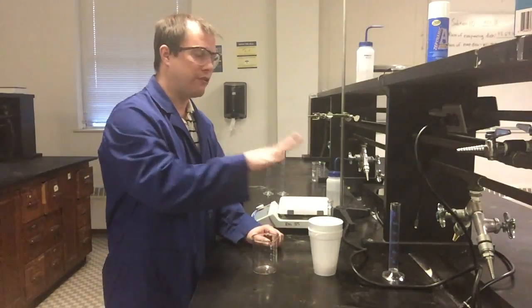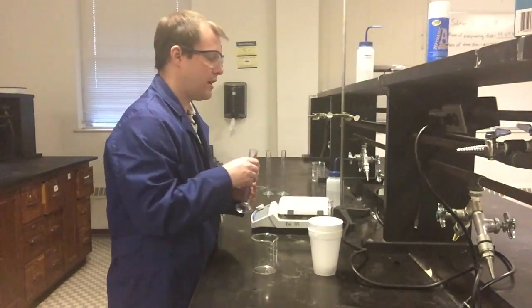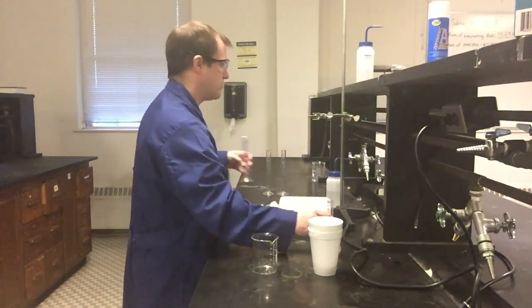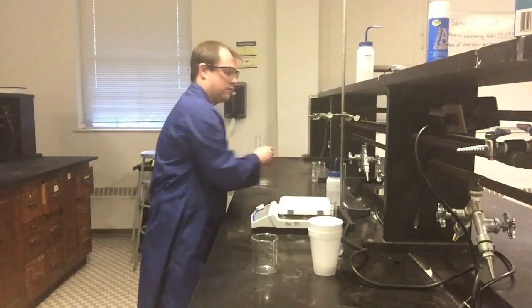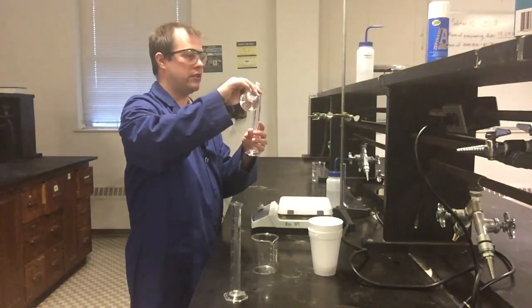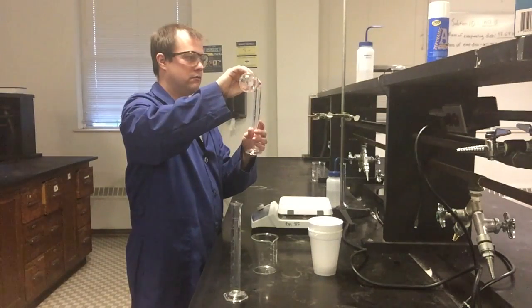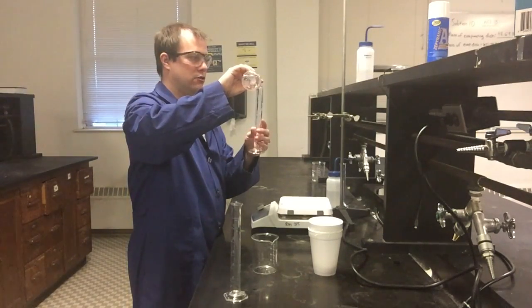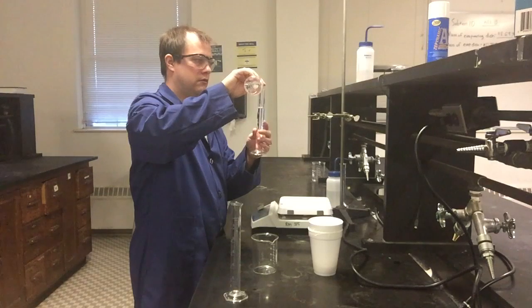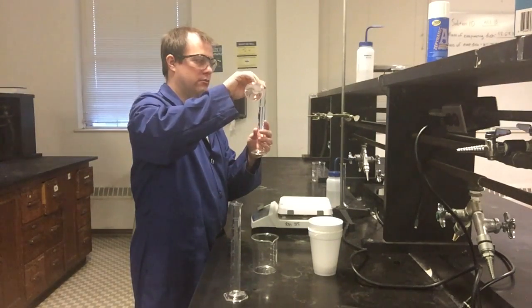Now, in terms of adding everything here, I do want to go ahead and measure out. I don't want to use actually the same one. I'm going to use the clean 50 milliliter graduated cylinders I've been using before. So I want to measure out 50 milliliters of now my acid solution so that I can add this to one of my cups here for the experiment. And I'm trying to be very careful pouring this last little bit.